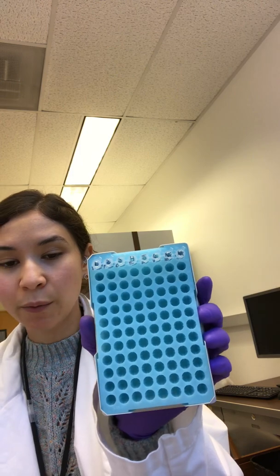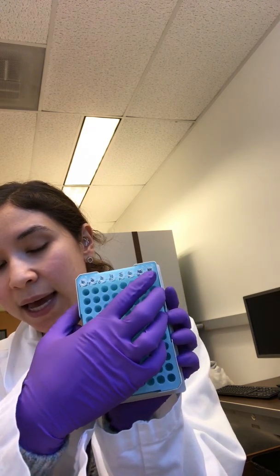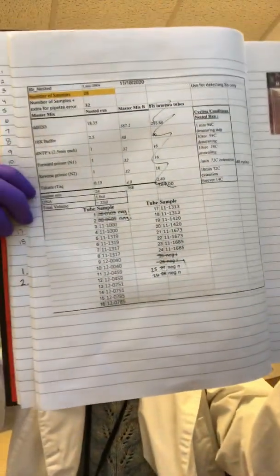Then we are going to make sure to close our strip tubes from the top. Never touch the inside. You don't want to risk contamination, just in case something's on your gloves. And go onto the top of your tubes after your master mix is in and write down which sample is going to go where. So I like to write IPCR in the corner with the date, and here are our 2 negatives, our NI, NI, because that's the negative initial. Your numbers should correspond to the template that you made earlier. So those are your sample numbers and your tube numbers. Make sure they correspond.